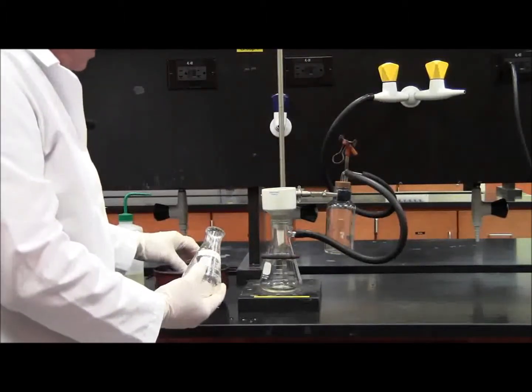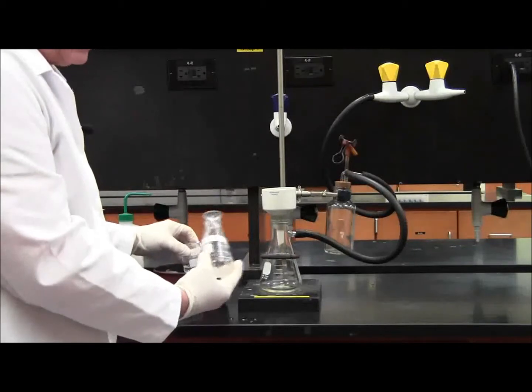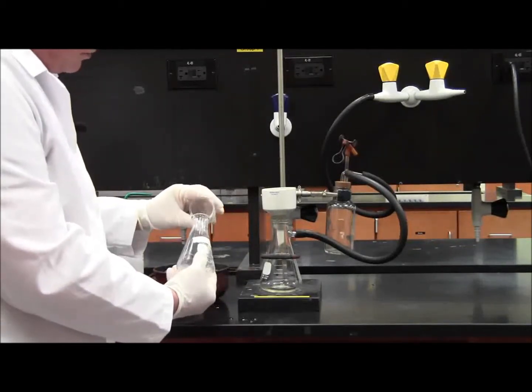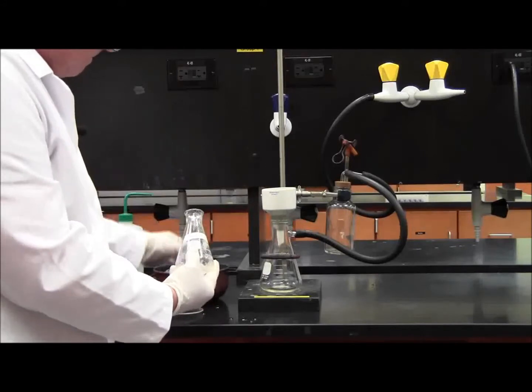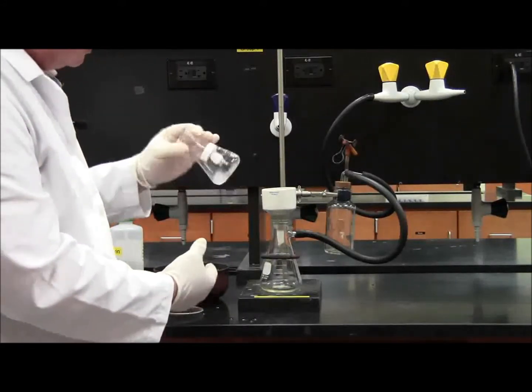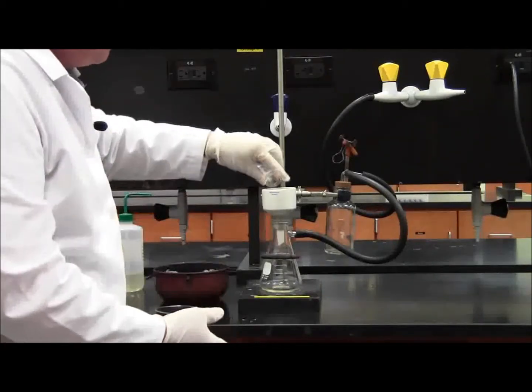Now, the cold ethanol will be used as a rinse and to help transfer the crystals. You're going to want to use about two or three milliliters. Rinse it around, try to get all the crystals you can, and pour it through there.